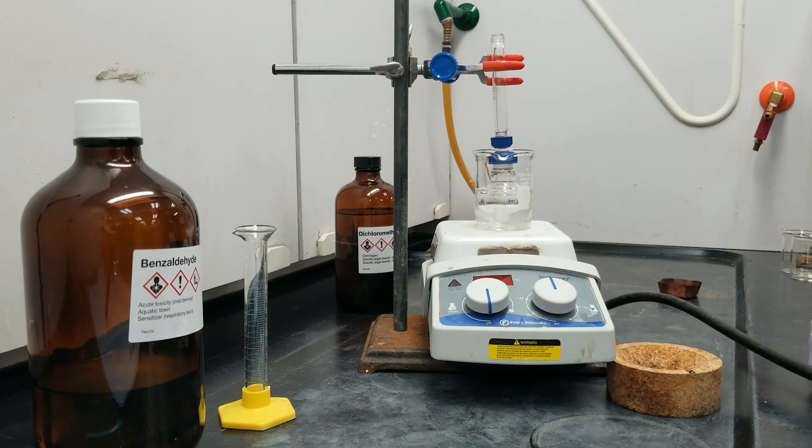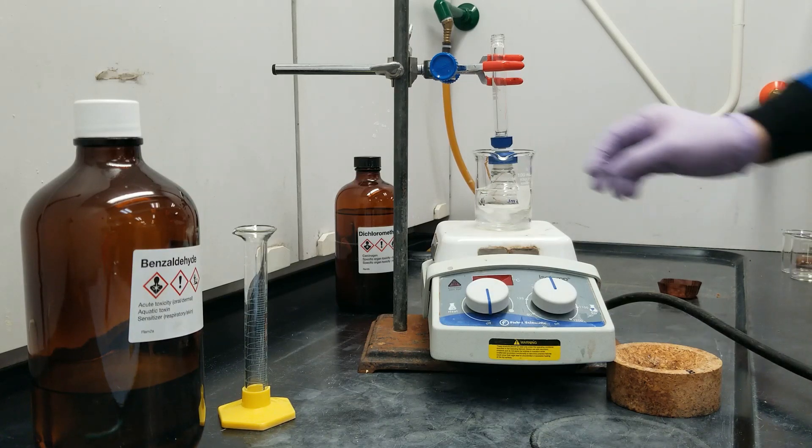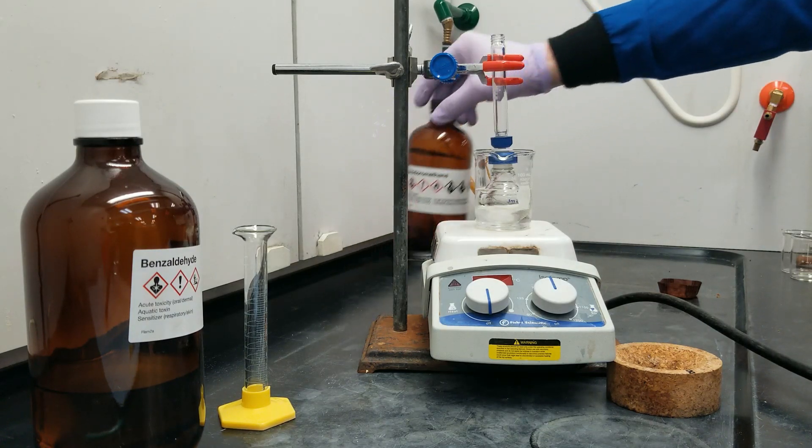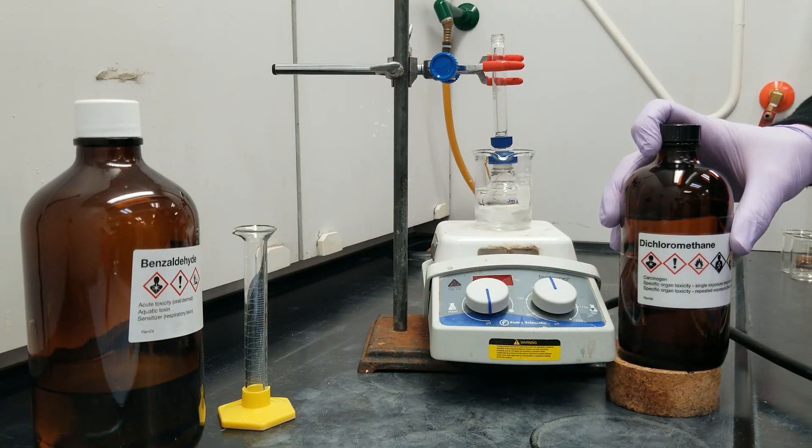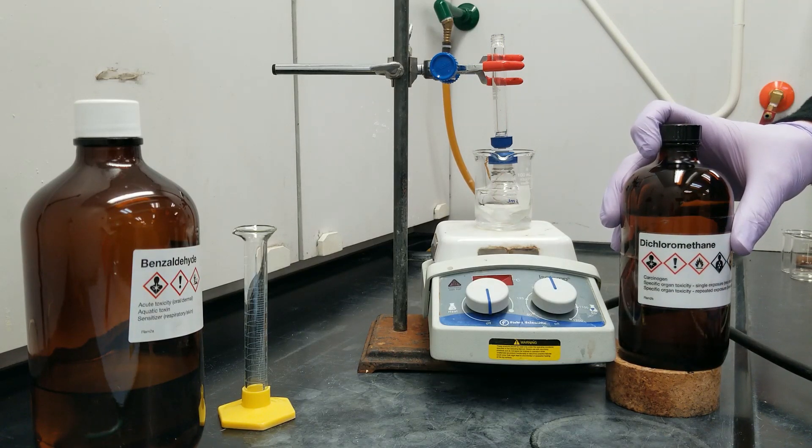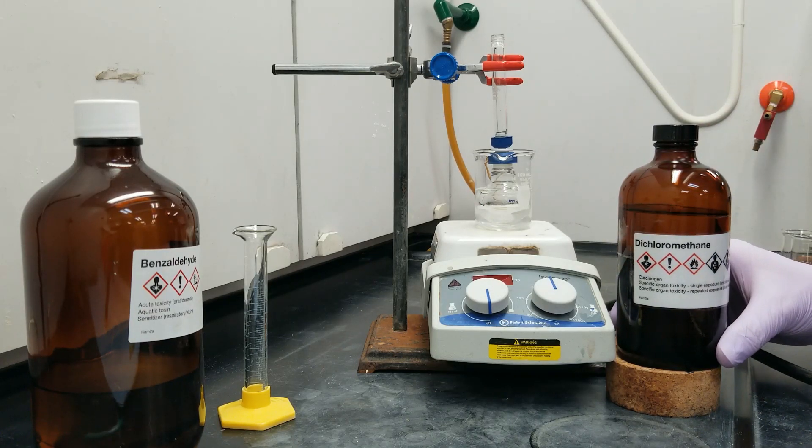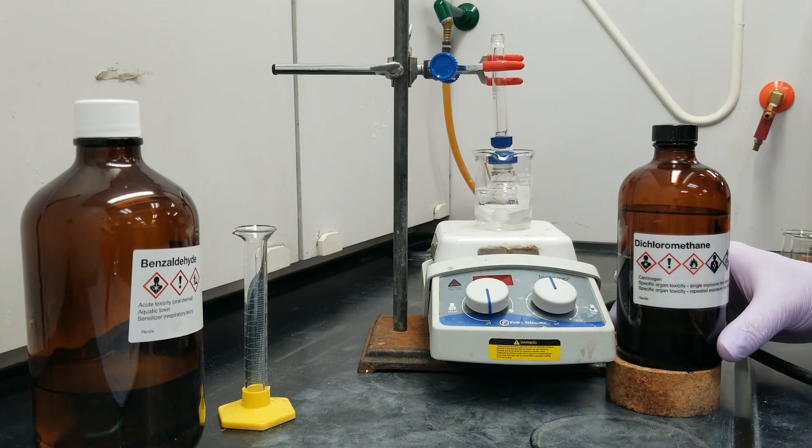So the procedure tells me that I'm going to wait about 10 minutes for this to be perfectly homogenized. In the meantime, let's talk about the other reagents. I already said that the benzaldehyde is there as a carbonyl with a positively charged carbon. We're going to react a negatively charged carbon onto that positively charged carbon.